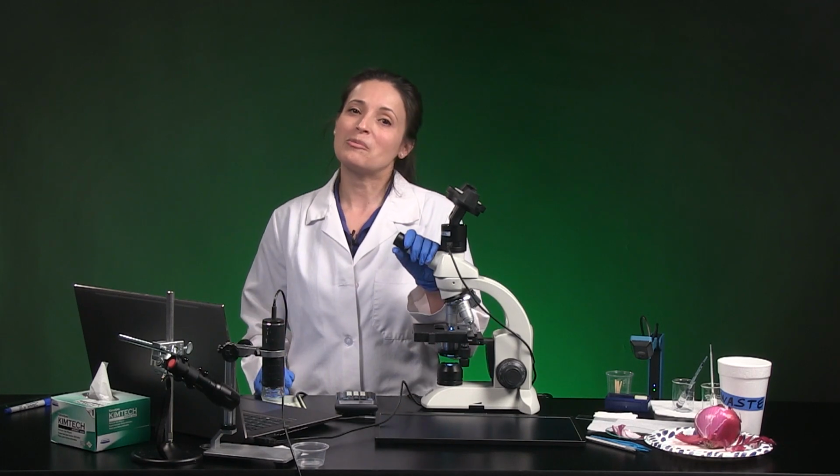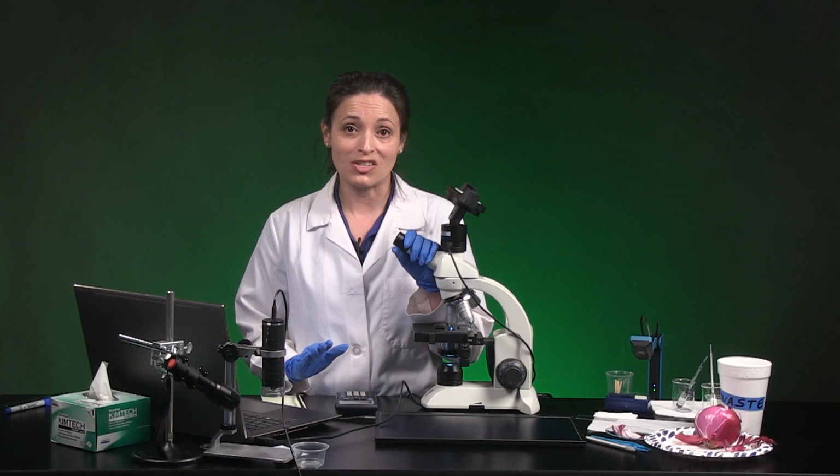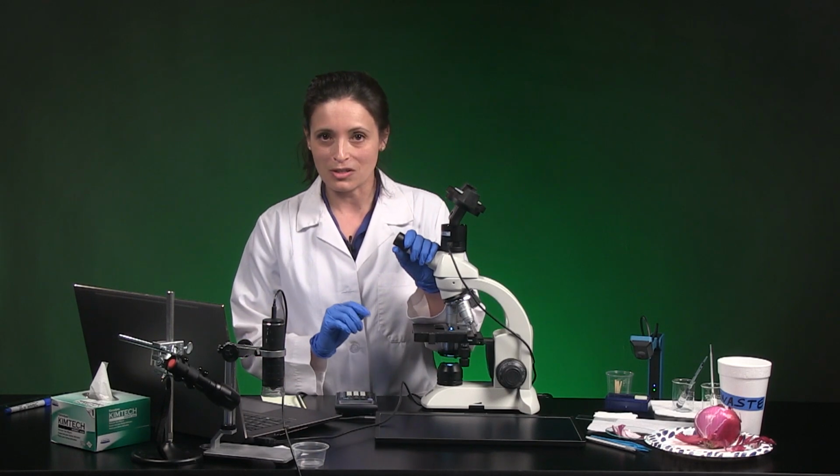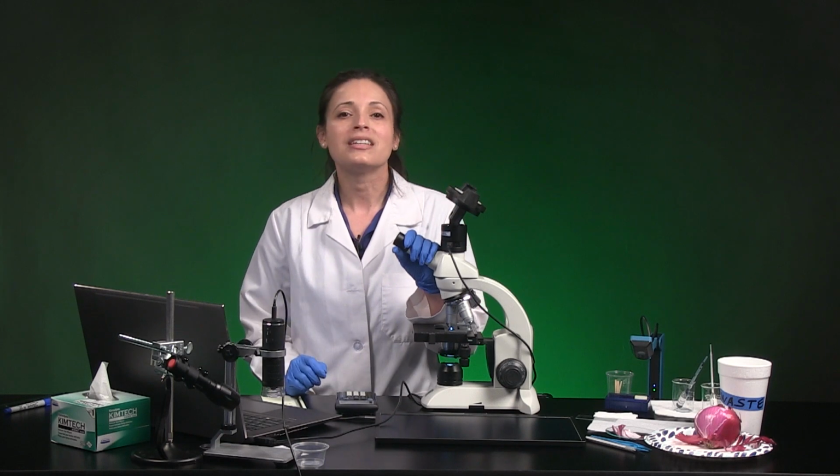Before moving on to part 3, choose one captured image at 1 magnification and complete the row for animal cells in table 1 on your answer sheet. Check with your instructor to see whether they prefer captured images or sketches or both, and go online to look up how to do an image capture on your device if you're not sure how.